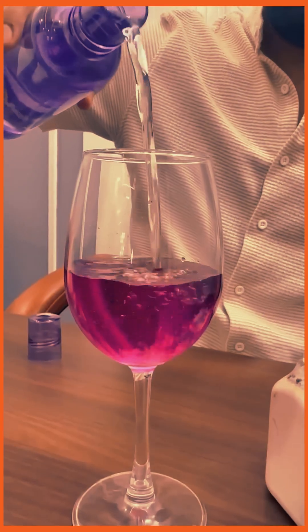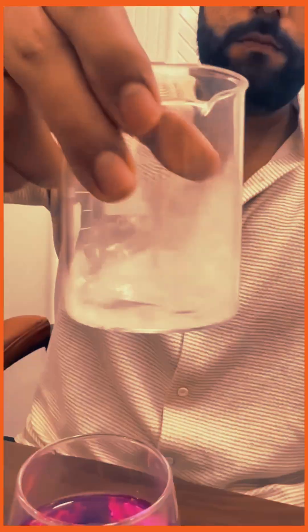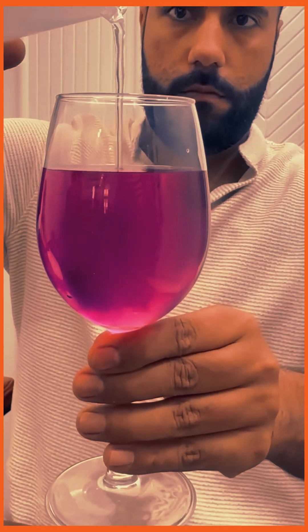We will add a little more water. After this, we will add NaOH — that is sodium hydroxide. We will mix this too and make a lovely solution. Now if you mix both of them, you will not see anything — no reaction has happened yet.